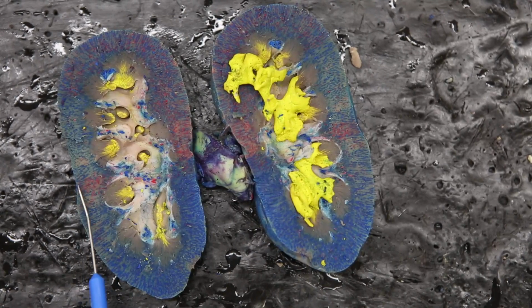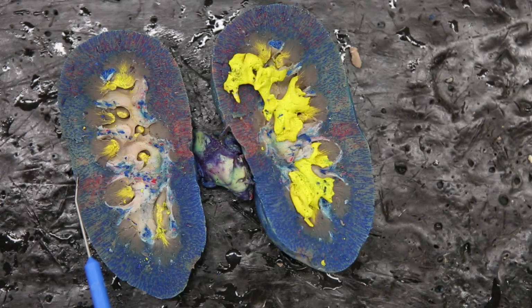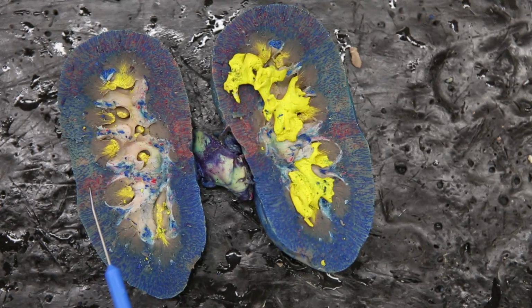Found out here in the renal cortex, you can see there are red and blue lines. Those are injections into the kidney to show the arteries the red and veins the blue. What you really can't see because they're too small at this view, you have to get more of a microscopic view here. You'll be able to see the actual nephrons. You'll see the individual blood vessels and the nephrons forming here, and they can dip down into the renal pyramids. So going to a more microscopic view will help you see the individual blood vessels as well as seeing the individual components of the nephron.